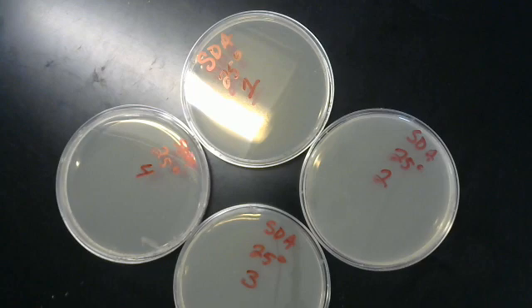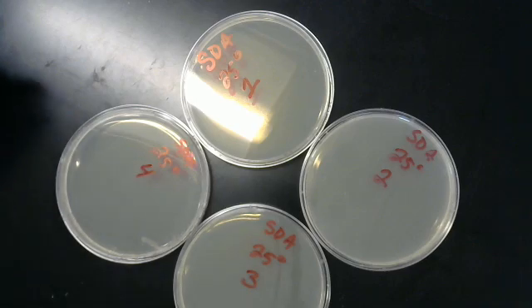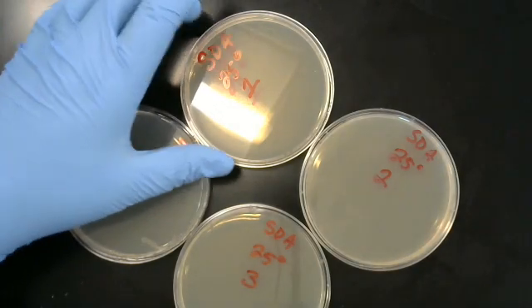And we're going to go over how to transfer these over. I'm not actually going to tell you the genus and species because your lab manual says that you are to identify them yourselves.